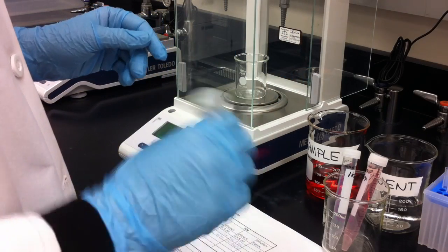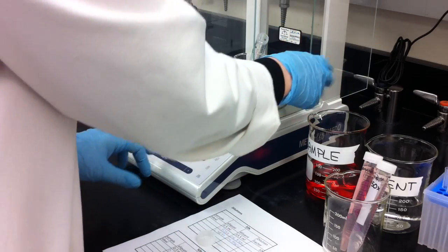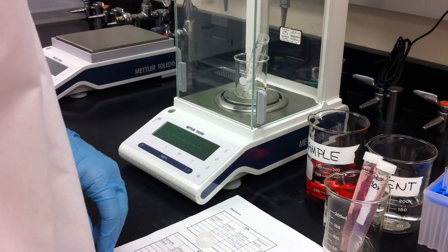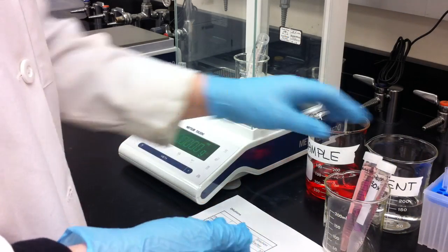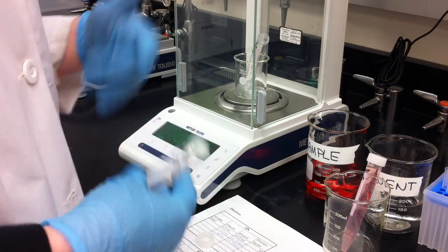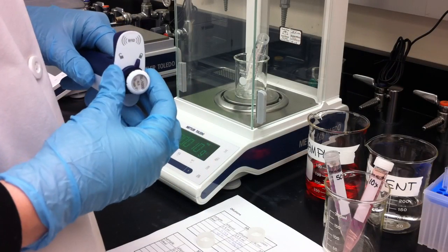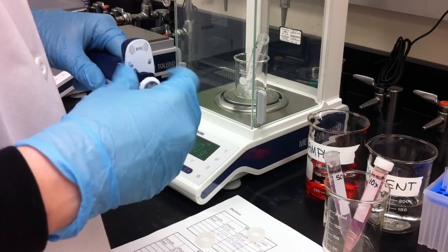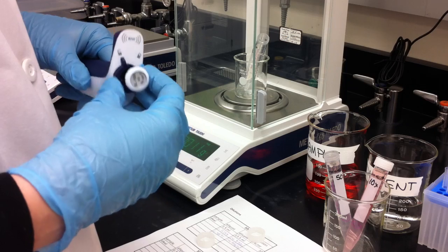And now, if we want to do a larger dilution factor, like if you're looking at something that's very concentrated, so like let's say we want to do 1000x, we'll just do the same thing where we put our tube in and then we tare it. But instead of using your sample solution, which we have been using, we're actually going to use the 50x solution. And if we are already using a 50x dilution, then 1000x is only a further 20x dilution. So we're going to add 0.75 milliliters of our 50x solution.